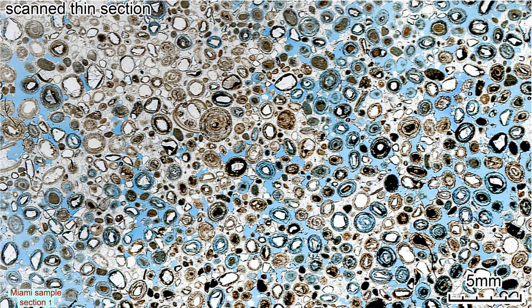This thin section has similar individual features to the Corinth section, but they are randomly distributed, not organized into layers as occurs in the Corinth sample. Ooid 10, upper left, at the margin of a cemented patch, is described next.